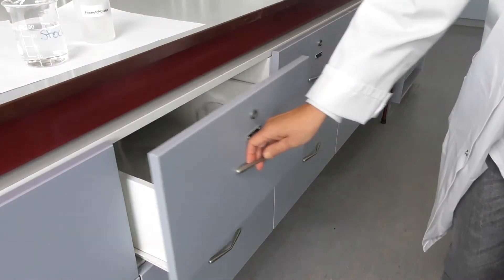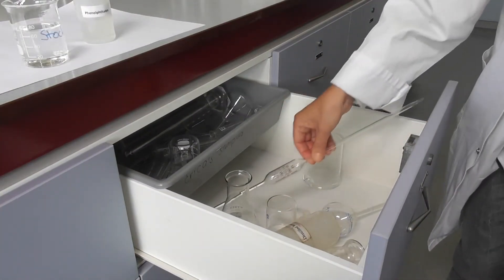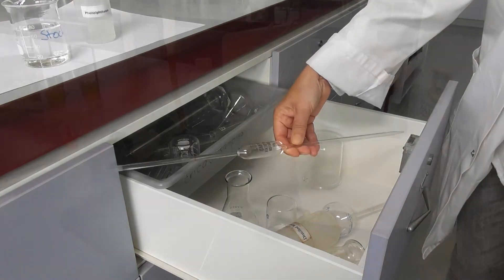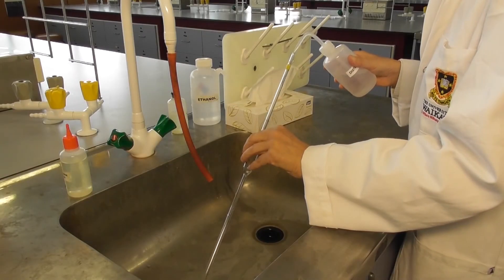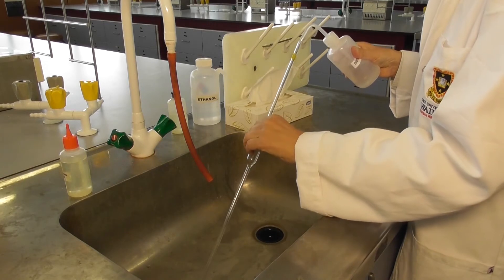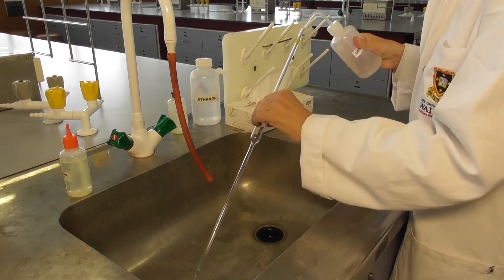The same idea applies to volumetric pipettes, but the rinsing process is a little bit different. With pipettes, rinse both inside and outside thoroughly with distilled water from a wash bottle.